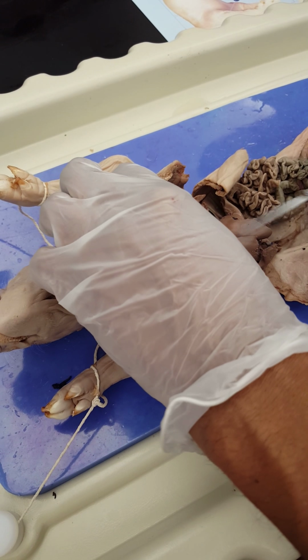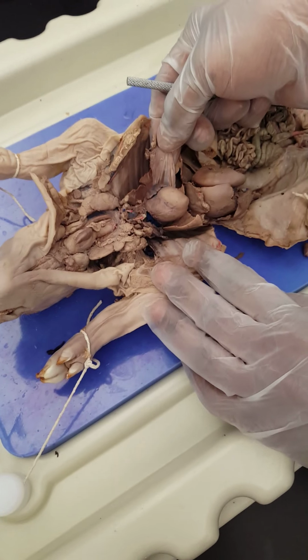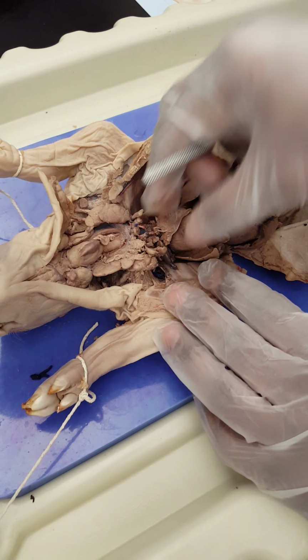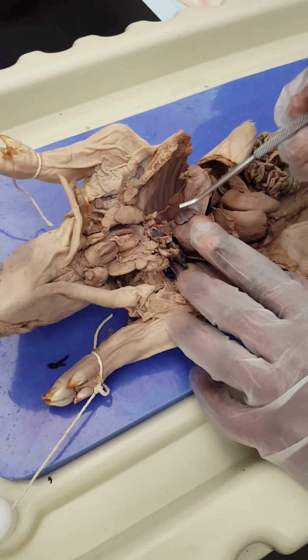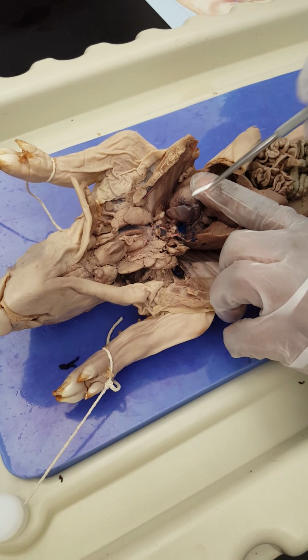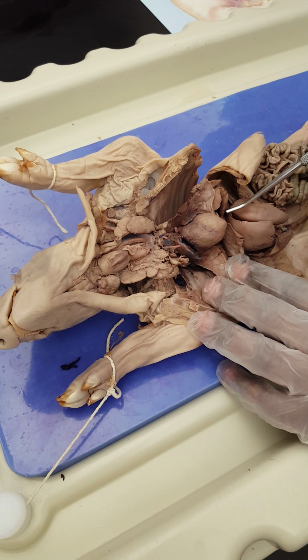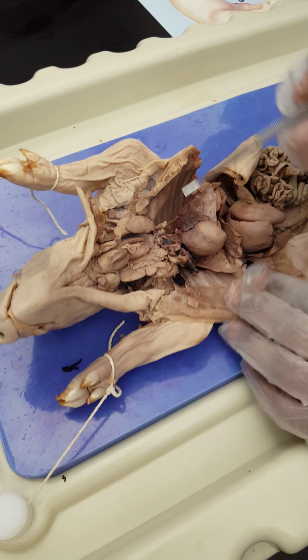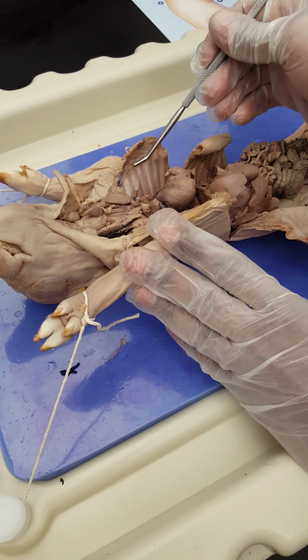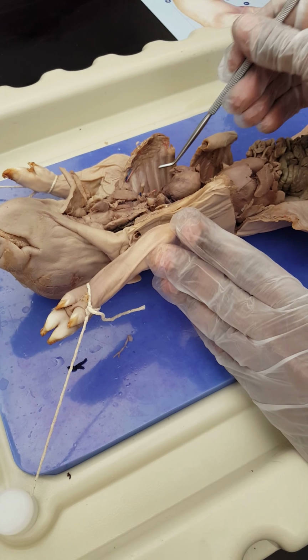This is the pericardium. All right? See the pericardium here? That's the covering of the heart. You got the left auricle, right auricle, this is the heart. Okay? Look at the ribs. Intercostal space, and these are ribs.